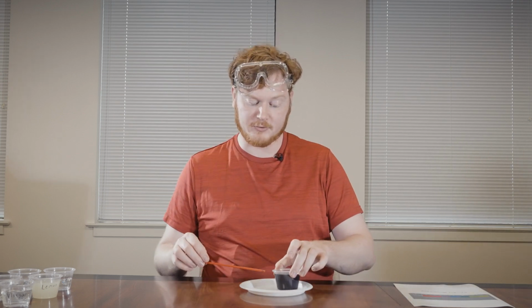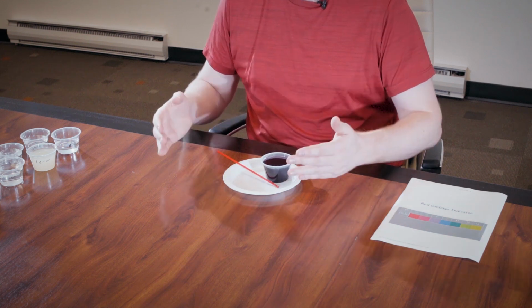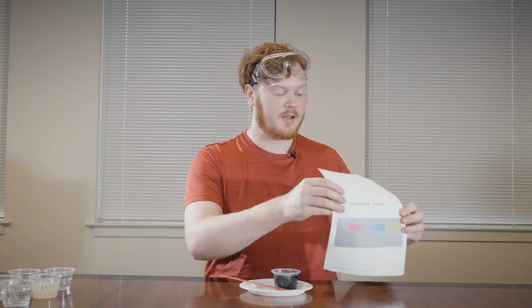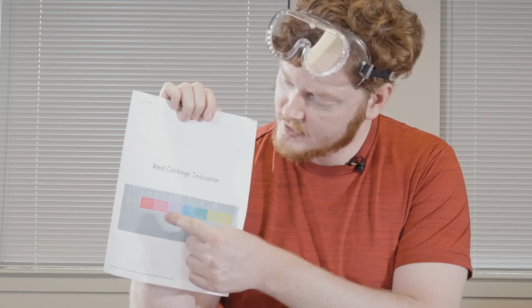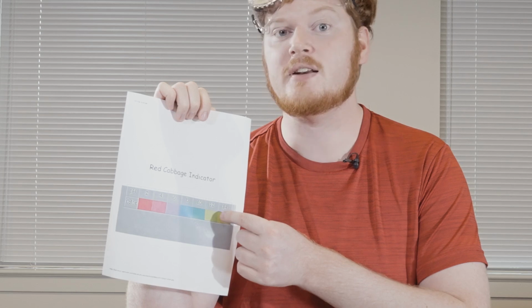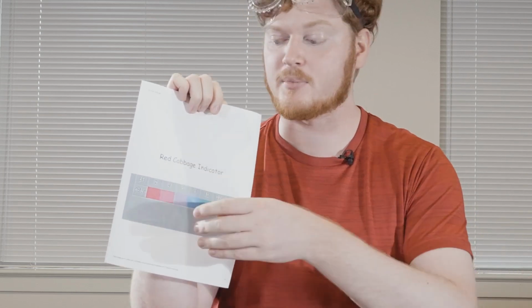What I'm going to do for my demonstration is I'm going to take my acid and base indicator and show you several different substances. And we have here a scale for the acid-base indicator, with 1 being the most acidic. Is going to come up as a nice, very red, very pink color. Purple and bluish will be a more neutral pH. And as we move into the green and yellow, that will become much more basic in composition.